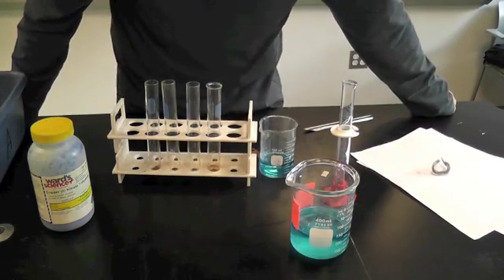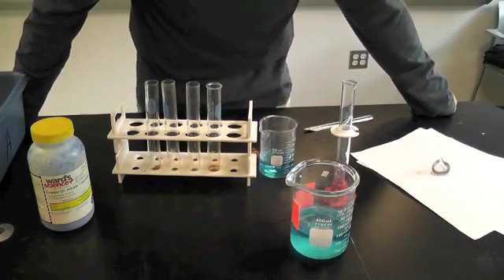And we're going to look at the observations, go over the concepts, and look at some advice also.